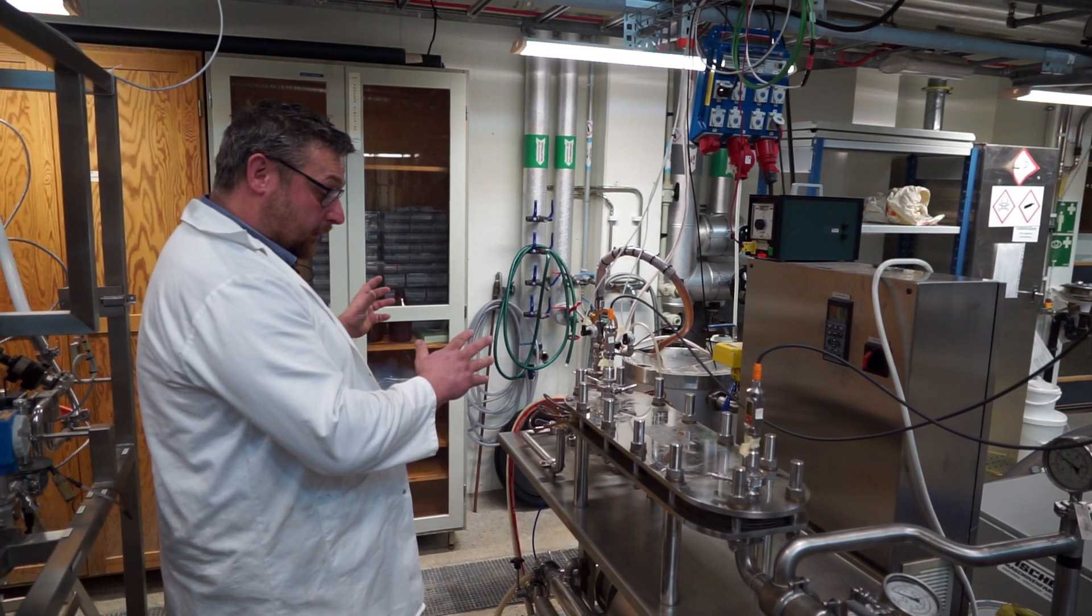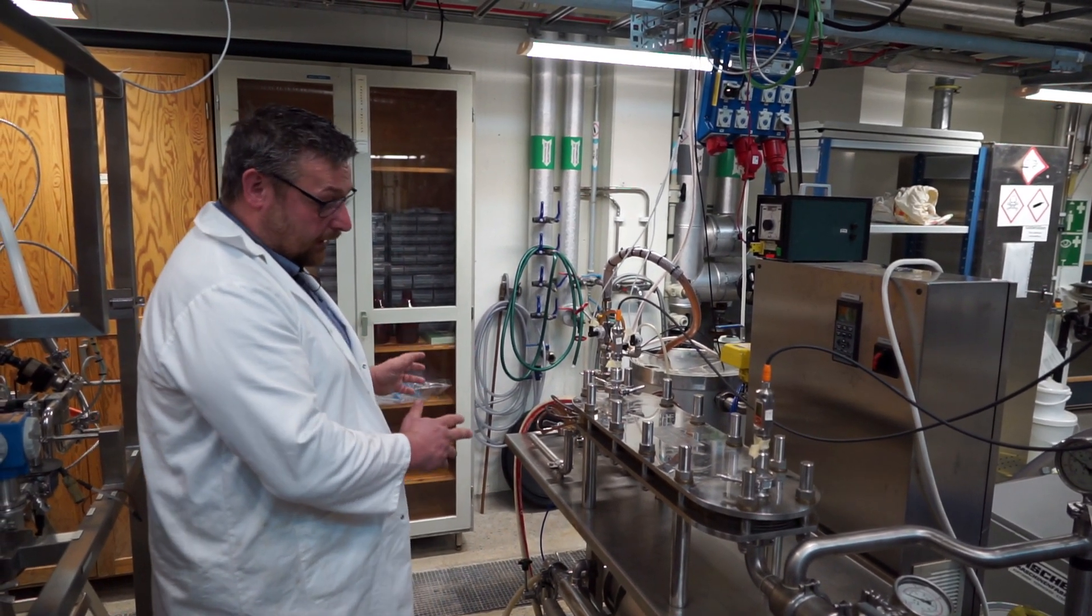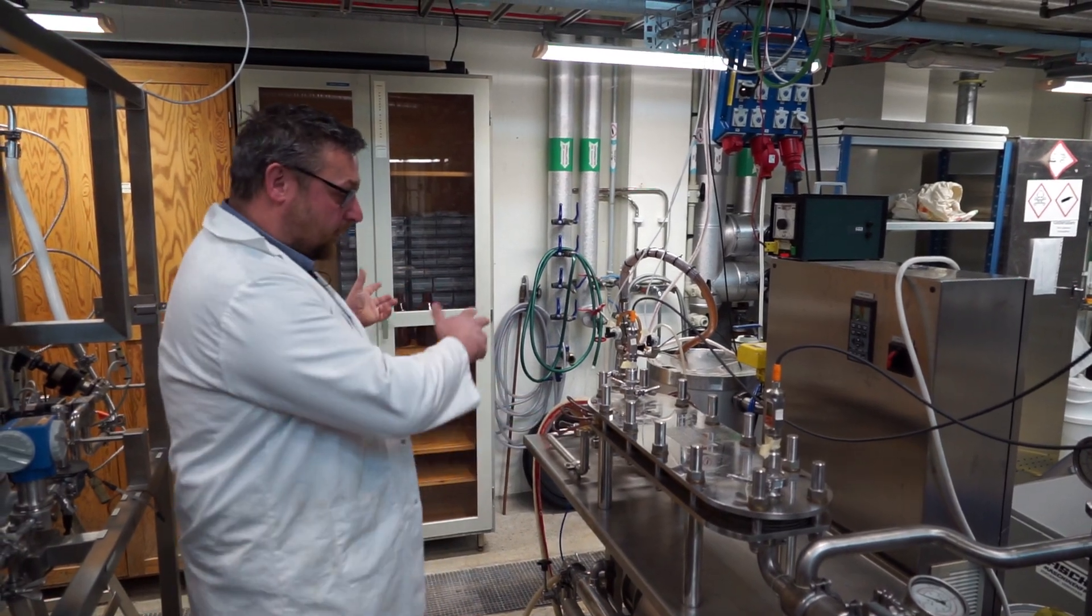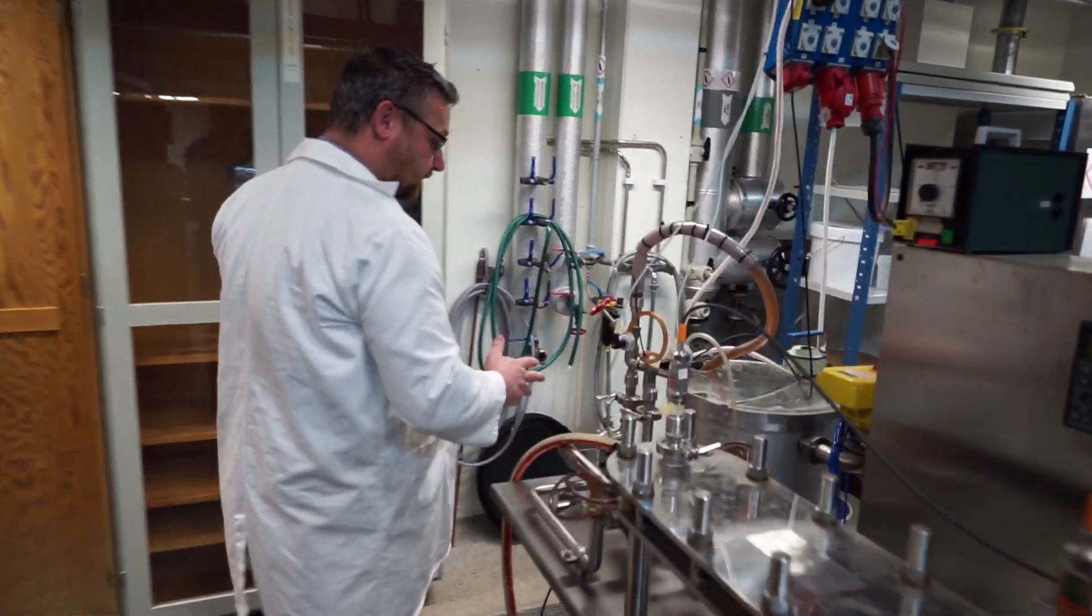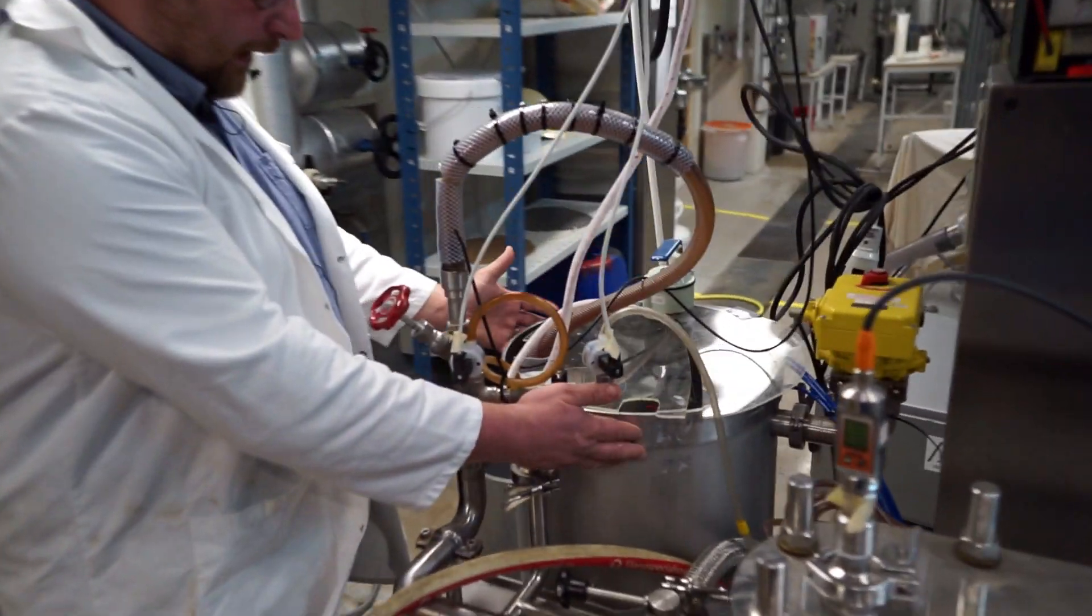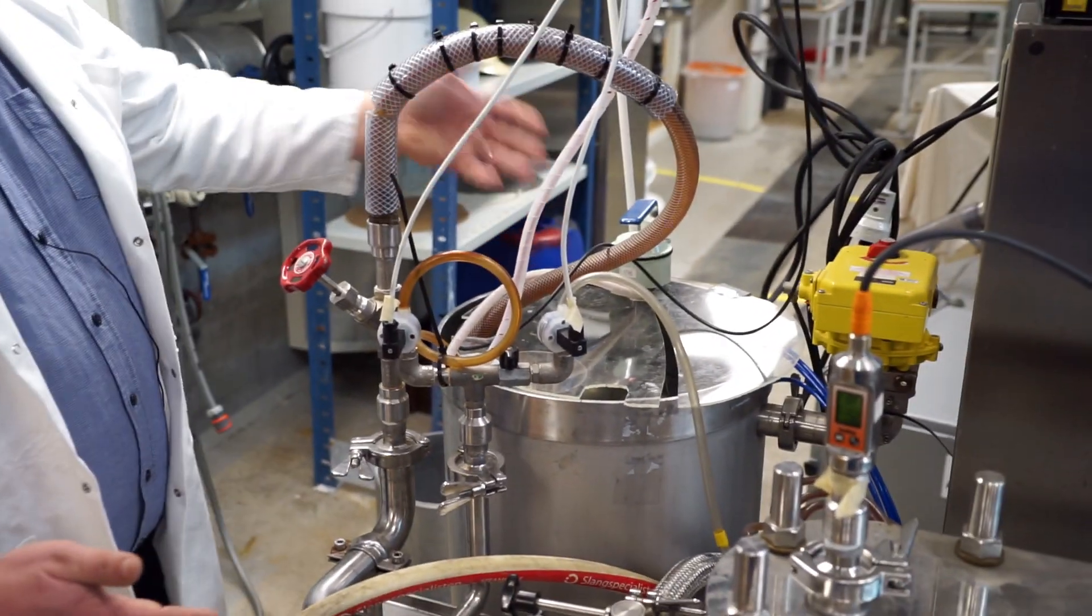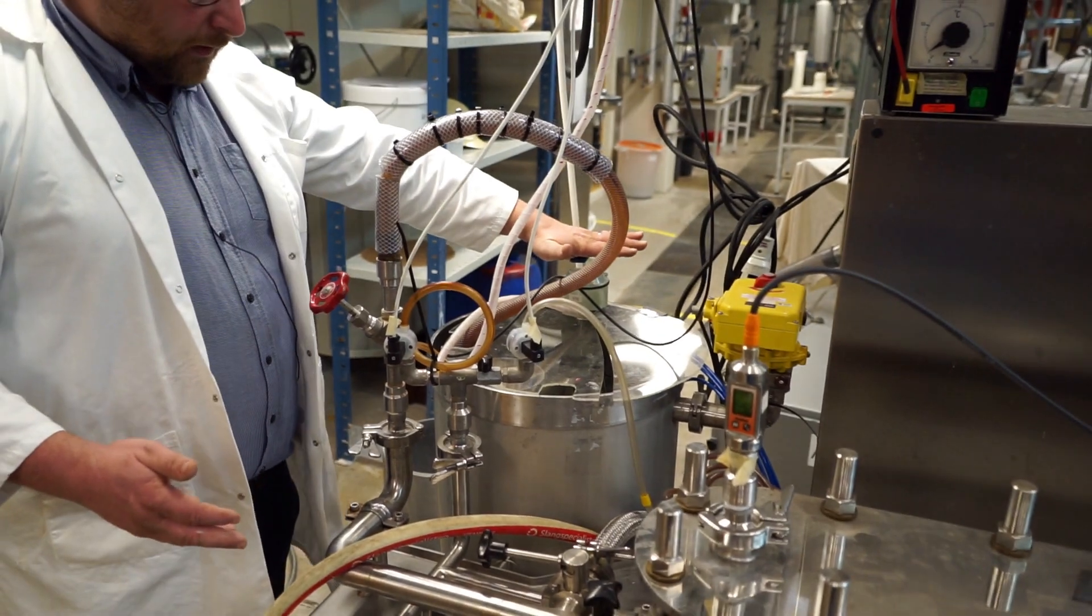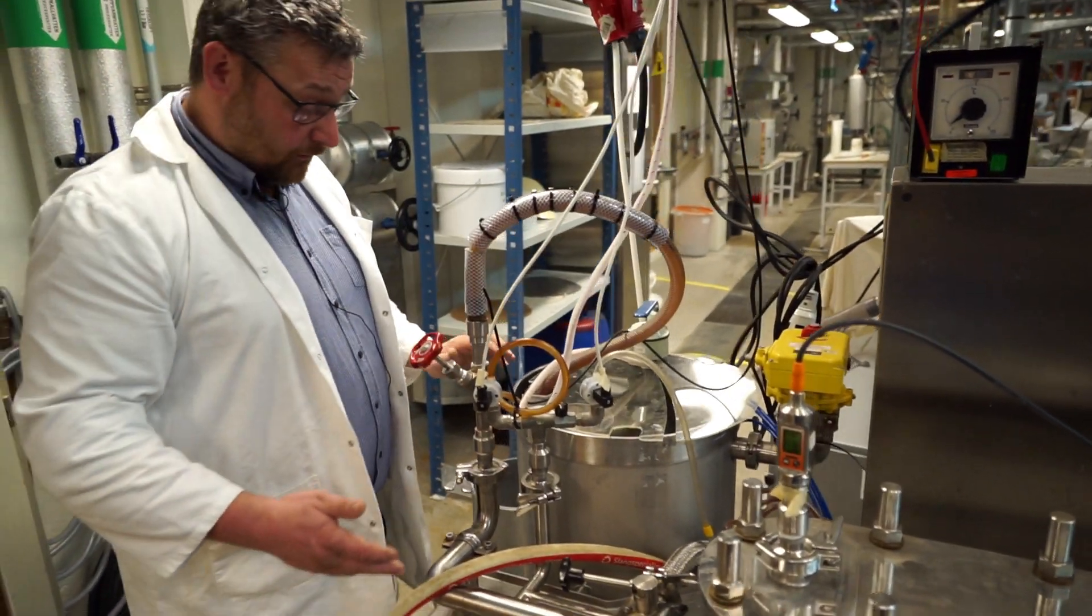So, this is an equipment where liquid is circulating. Let's start with the feed tank. The feed tank is over here. And right now we have a water solution in there. There's a heater in that one because we want maybe to heat up the solution there.